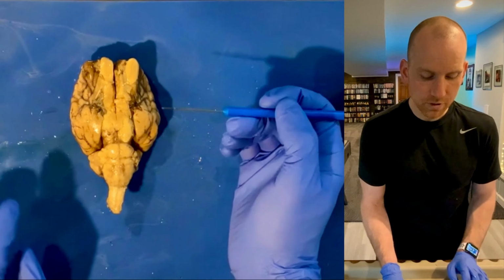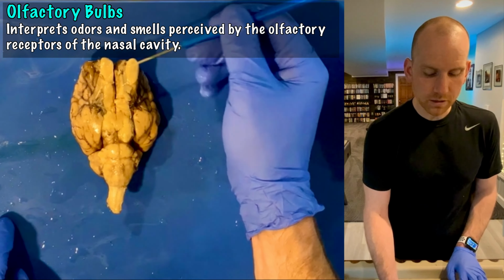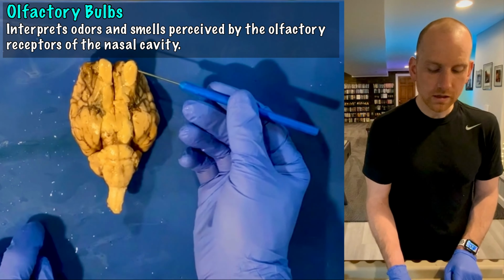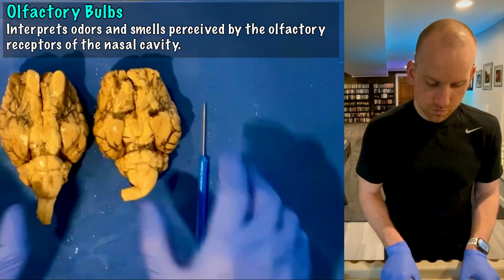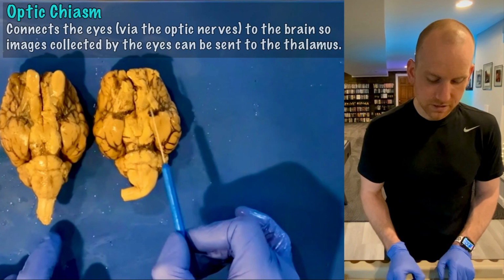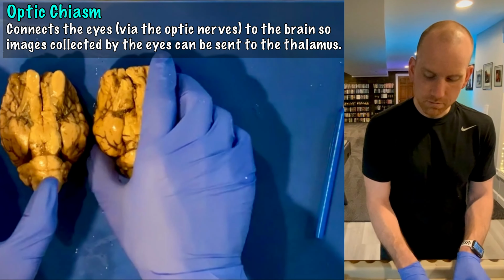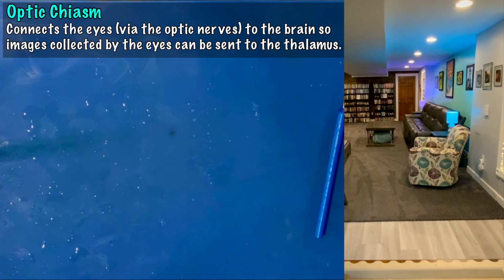Now above that, we have a couple other important structures. We've got olfactory bulbs right up here. Those actually help us to smell. And then something you don't see on either of these brains, which is actually a bit of a disappointment, is the optic chiasm, this X that normally appears on the brain. So let me grab another brain that I have here.